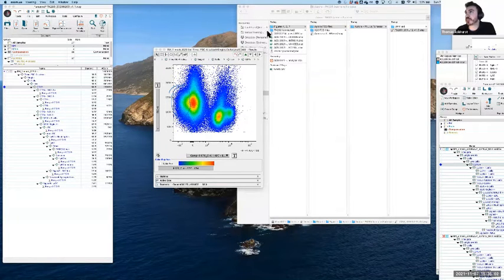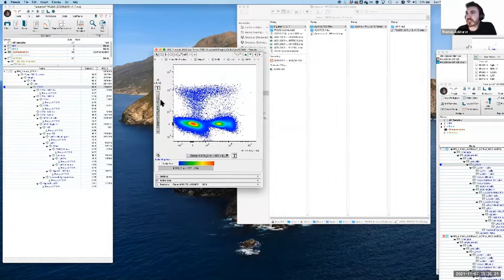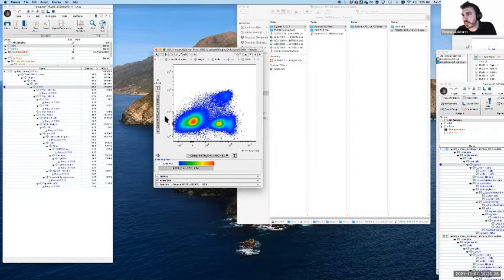I'll just put that back to red. And so, okay, that's suspicious. Based on what we learned before, one of the fluorophores is going to be overcompensating out of APC, based on the patterns that we worked out. And so we can reasonably go through our list until we find something that makes sense. That is the process, right? You have to do the work to go through things to find where the culprit is. It's not going to be FITC because it's never FITC.